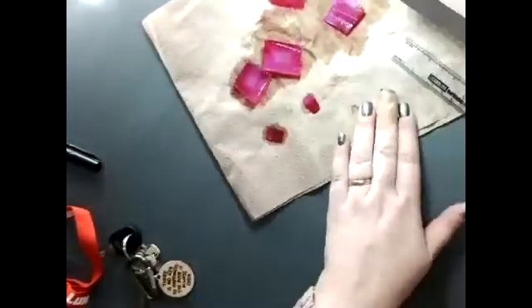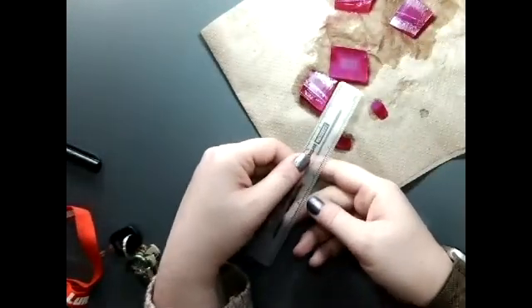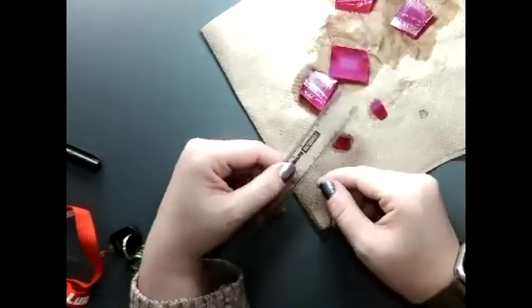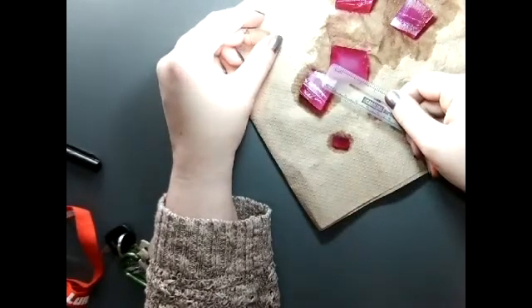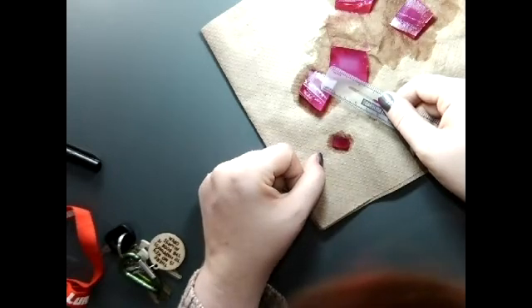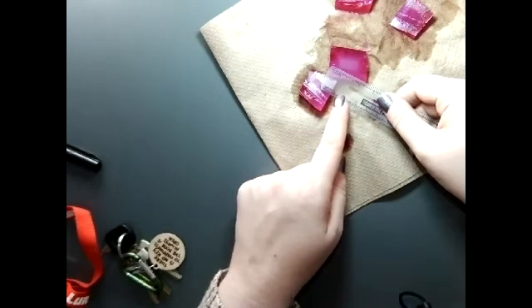Then we go next to this piece, this is our 2 centimeter cube. And the depth of diffusion is, let's say, sorry, it's very difficult to do this without being able to put my face close to it.